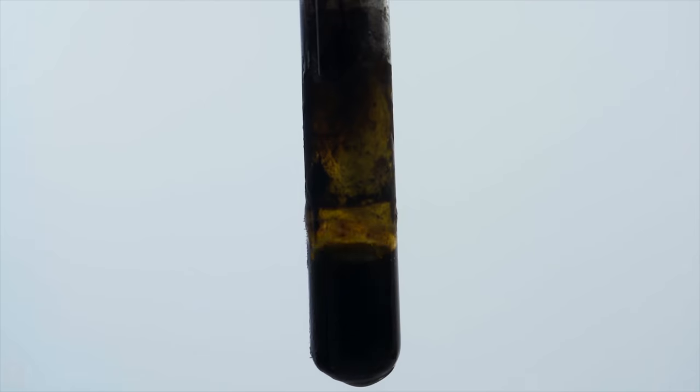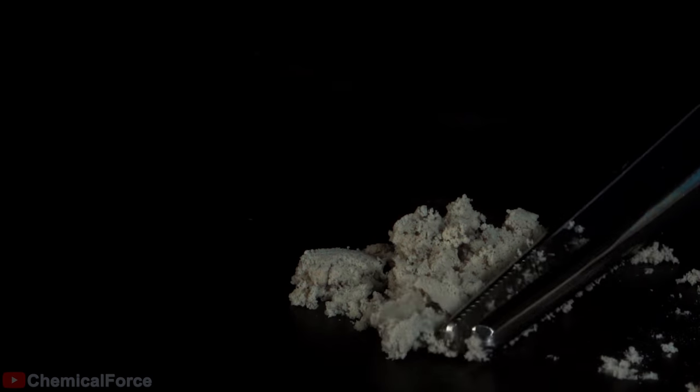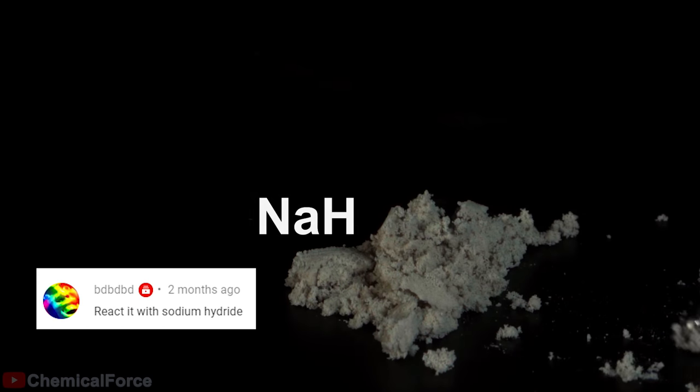The wooden splint went out. What do you think this gas was? Was it hydrogen or hydrogen fluoride or ammonia or something else? Sorry guys, I can't let you go without showing you this lovely explosive reaction between this acid and a strong base, which is sodium hydride.